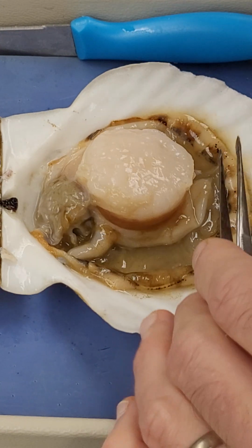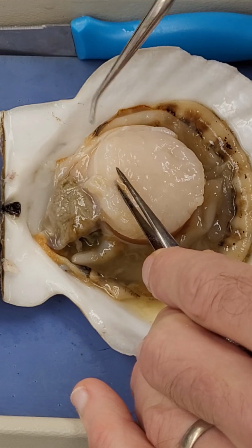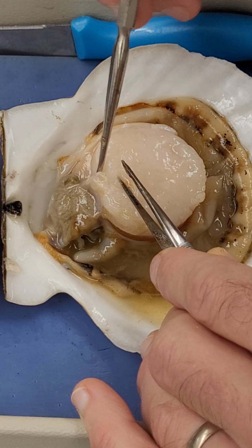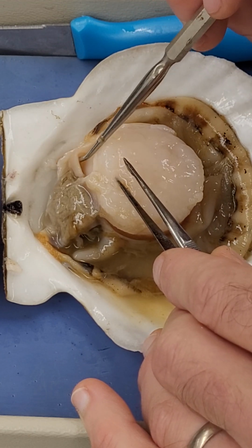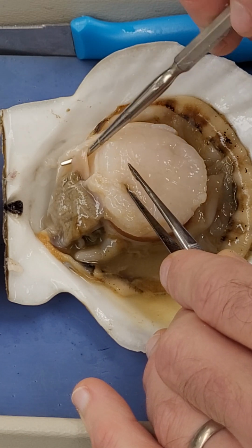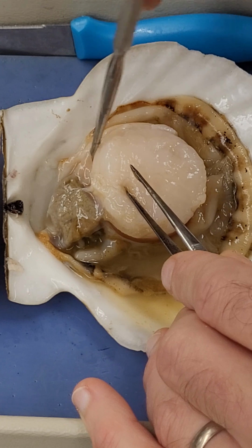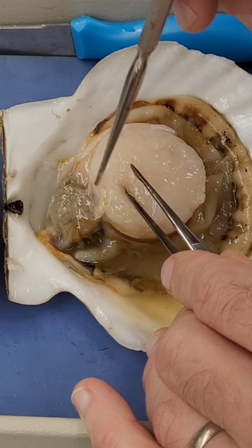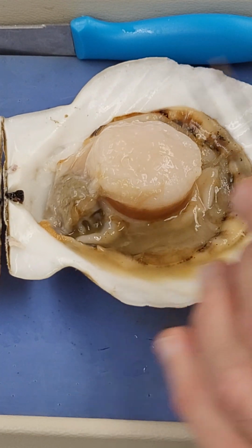Okay, lastly, let's flip over to the top side, and then we're going to look at this pericardial cavity just up here, which I've actually sliced and cut open to expose the ventricle and auricle, which are located here. I can see a clear ventricle. The auricle is much harder to see. It's normally located underneath, and it's a little soft bag, but I don't think I can see it as clearly as I would like. So I'm not going to focus on that one right now. Okay, that is a scallop.